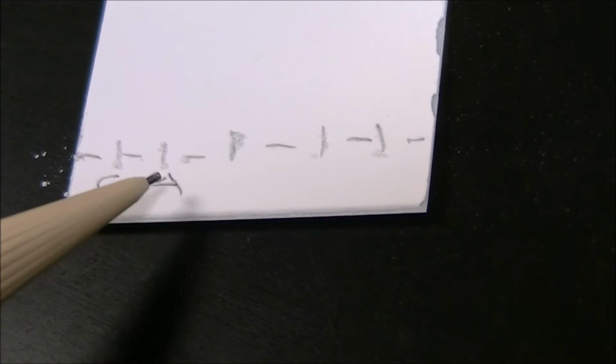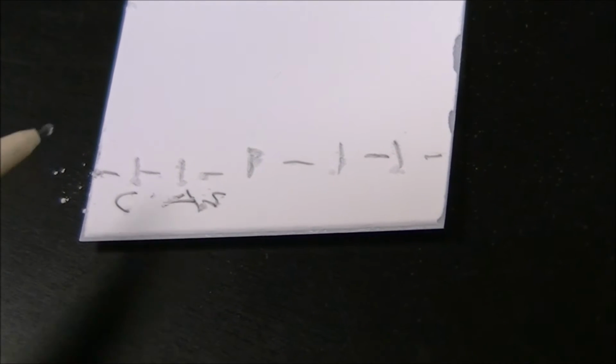Now you need to keep track of what solution you're going to spot on each of these lines. So you know the unknown goes in the middle, but if you want to put letters underneath each one to keep track of it, say this is caffeine and this is aspirin or something like that, you can do that. You can put them in alphabetical order, but you just need to be able to keep track of which spot is which solution.